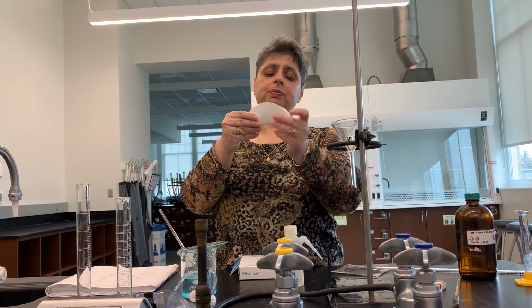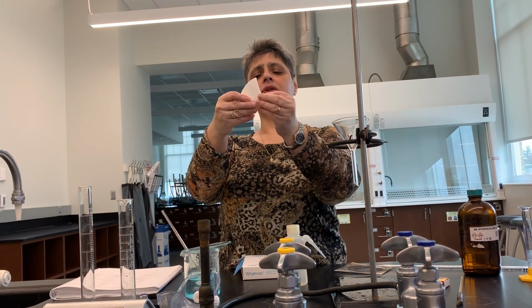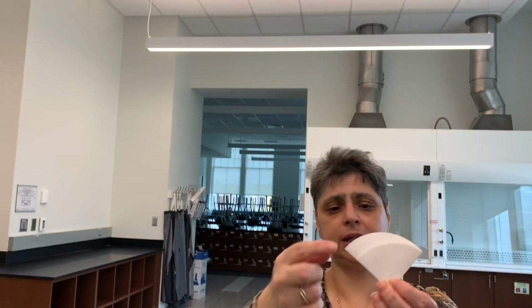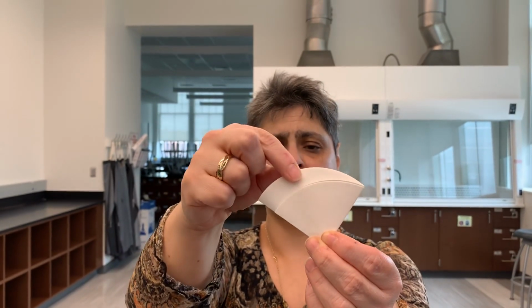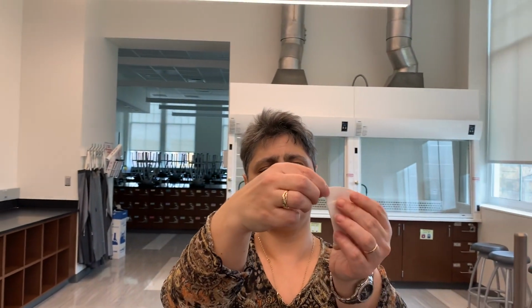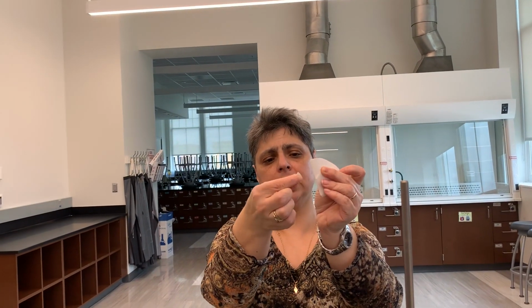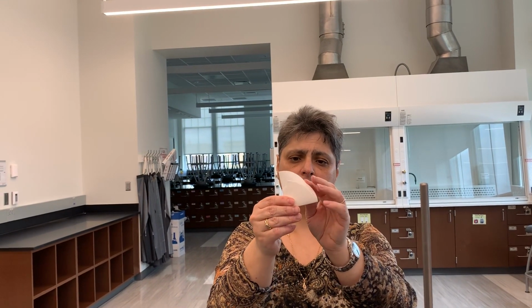So I'm going to fold the paper in half like this, and then not quite in quarters, making one quarter slightly larger in size than the other. Hopefully you can see here, this outer quarter is a little smaller in size than this inner quarter. And then I'm going to tear off the corner that I'm holding right here, a portion of the smaller quarter. I'm going to save it, and I'm going to show you later what I need this for.